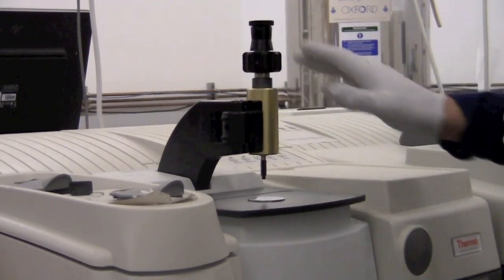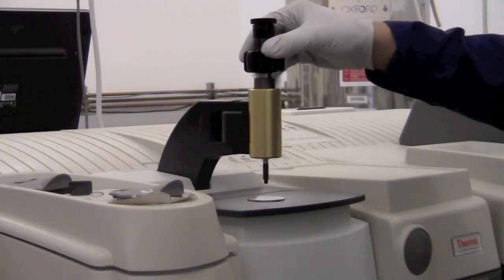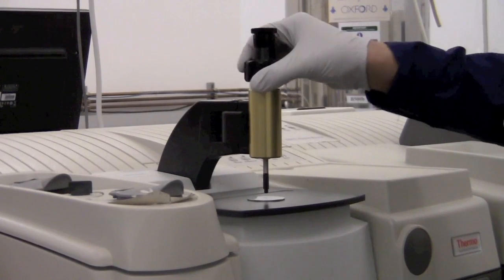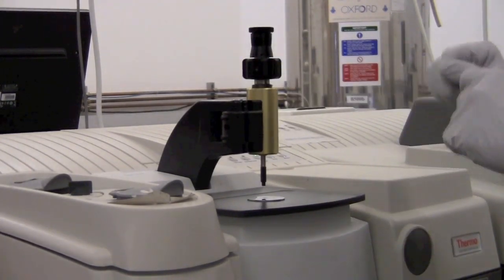When you're collecting the background, you should not have anything over the diamond. You don't need to have the anvil pressing on the diamond or anything covering it. It can just be like this. We can go back over to the software and click OK to collect the background.